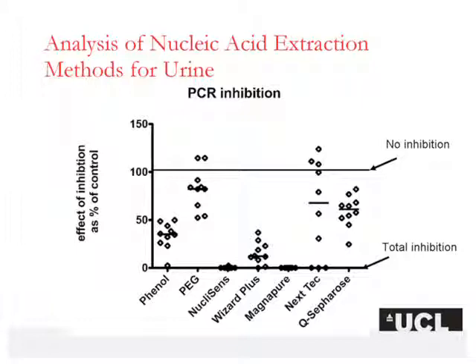And of course, it would be reasonable to expect that this effect wouldn't be too much of a problem if using a well-defined purification procedure. Well, in this example of a set of data, again provided by Jim Huggett from UCL, you can see quite clearly that using any of the well-recognized purification processes, none of them were able to absolutely remove all traces of inhibitor from, again, DNA extracted from urine. So it's pertinent to remember that however well you believe your extraction process has been at removal of inhibitors, it's important to check the sample and ensure that they are pure.